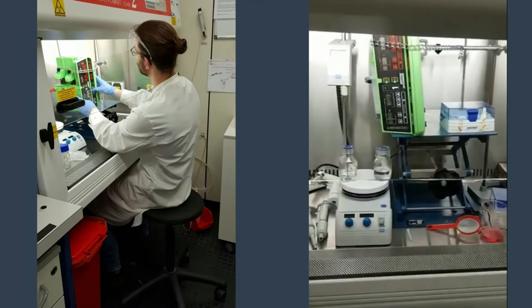For the printing process, we set up a syringe pump system in an ethanol-sterilized laminar flow cabinet. To guarantee a sterile environment, we then positioned a UV lamp in the cabinet for 30 minutes.